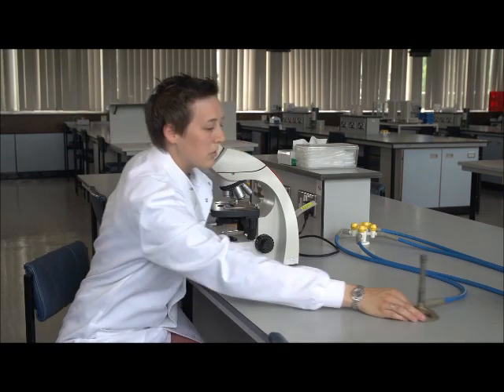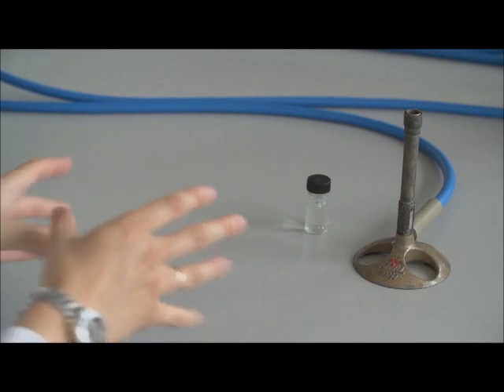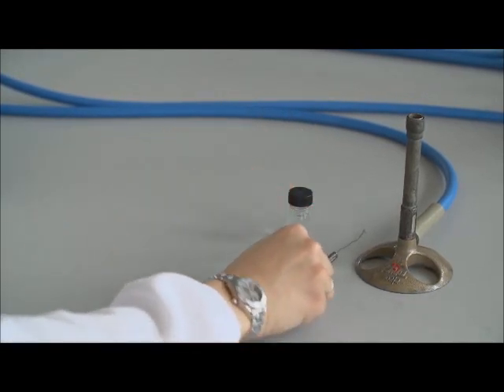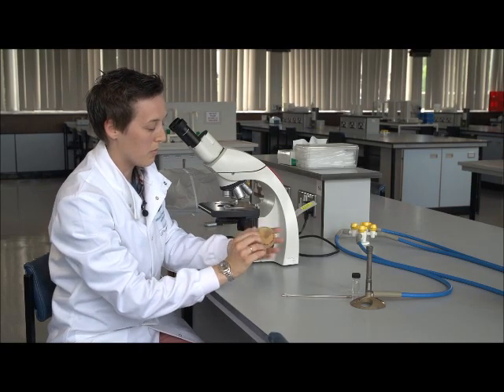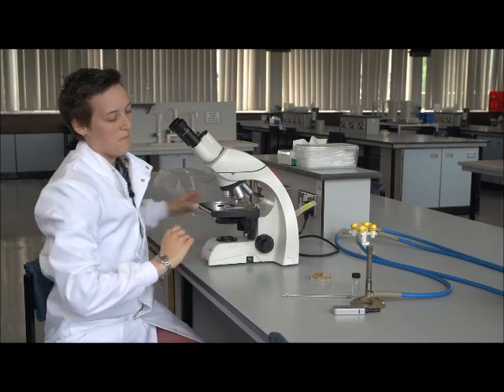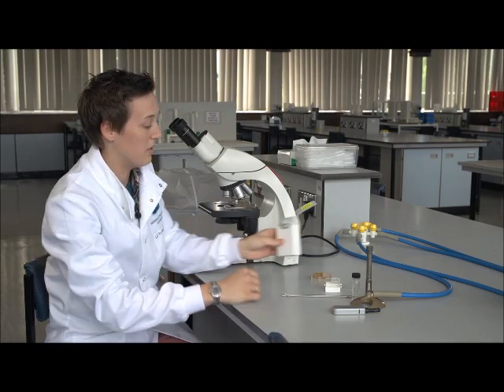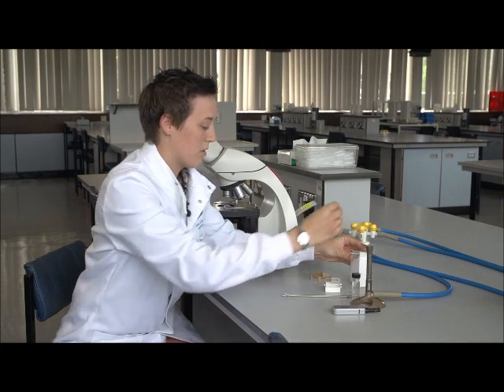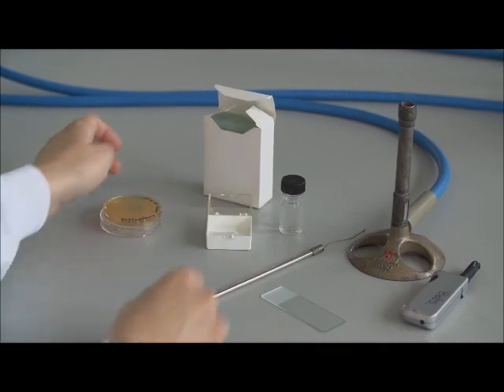So first of all, we need to get some of the equipment into place and have it all in a place where it's nice and easy to work with. So we've got some sterile distilled water, an inoculation loop, our microbiological specimen, which is some yeast for today, lighter for the Bunsen burner, some cover slips, and some microscope slides. So first of all, I'm going to get a microscope slide out so it's ready to work on. Our cover slips are there ready.